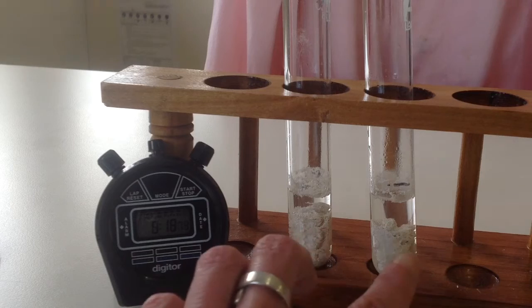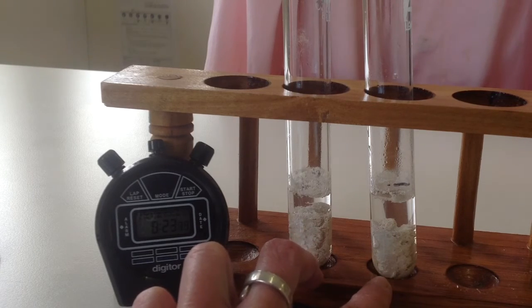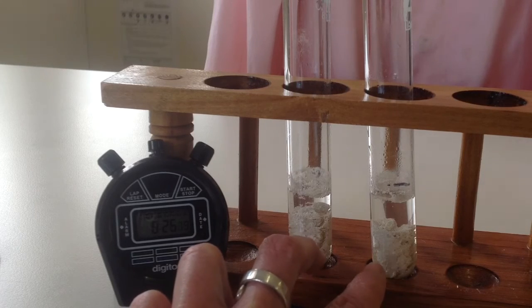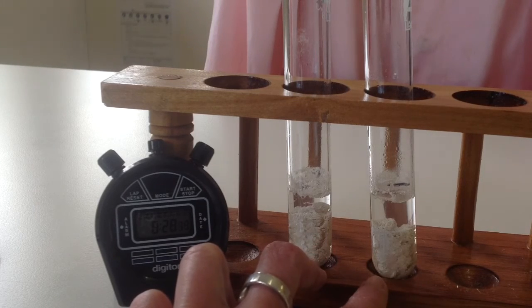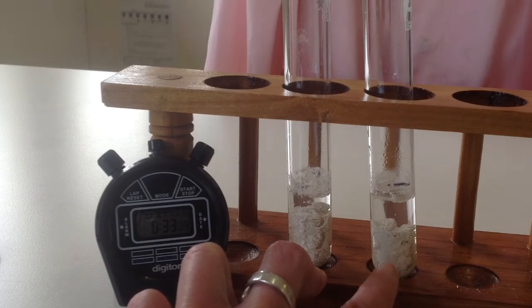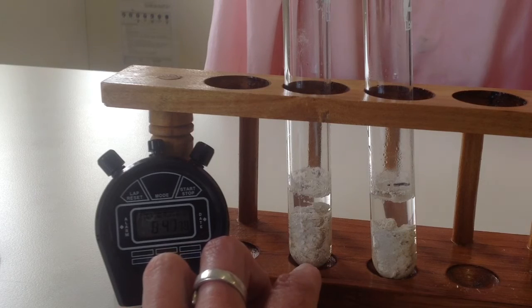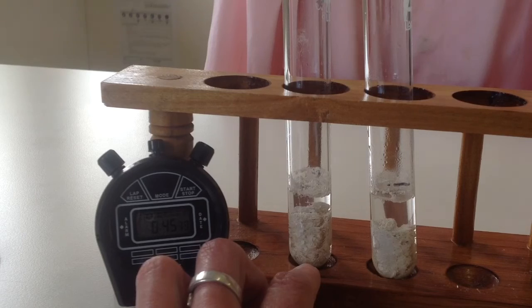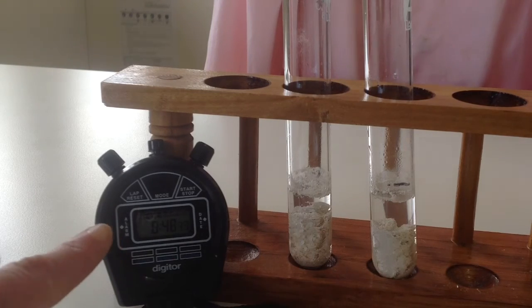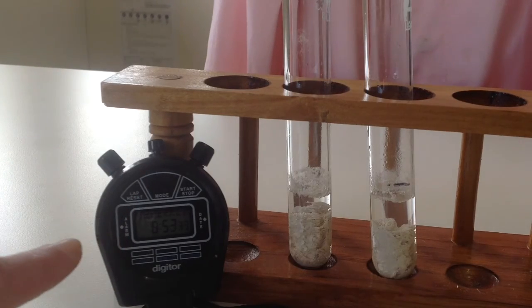At this point, the temperature of the acid will have reached room temperature by now. Probably an improvement I could have done is put this test tube in a beaker of hot water so it kept that heat, and I could have put this one in, say, a beaker with some water and ice to keep it cold. So I'm happy to finish that off at this time for both of them because they would have both reached room temperature by now.